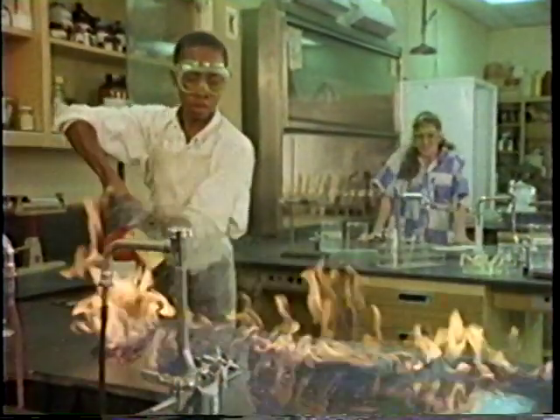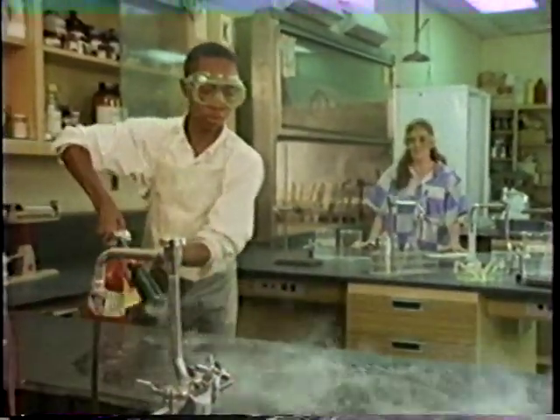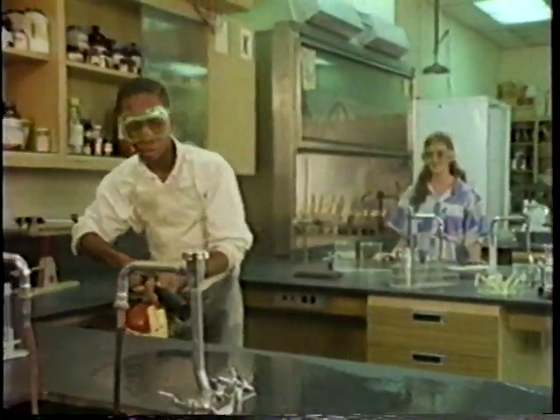First, I tell everyone to move away. Then I grab the fire extinguisher. You know how to use it? Sure do. Mr. Petrie showed us how. And what if someone's clothing caught on fire? Would you use the fire extinguisher? Oh, no. A fire extinguisher should never be used on a person. Then what would you do? I'd smother it using the fire blanket. Located where? Right over there.